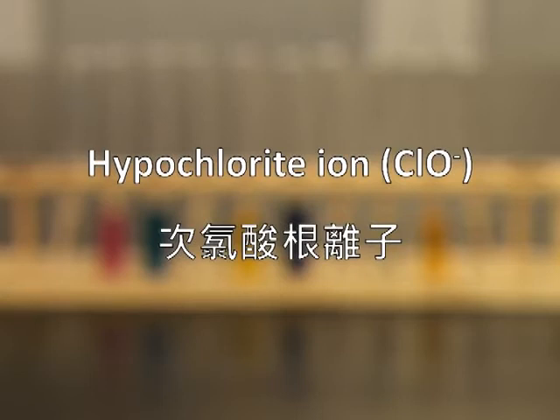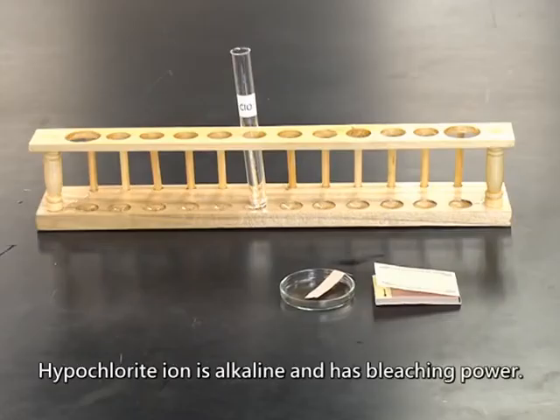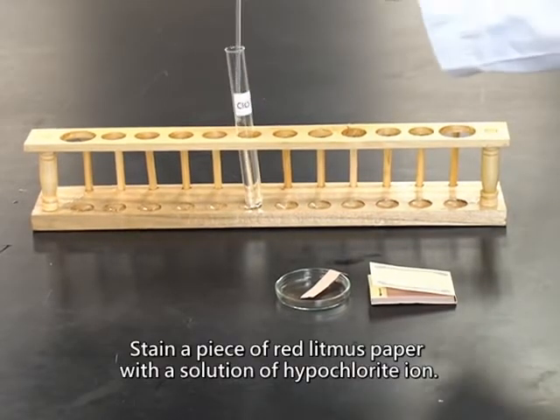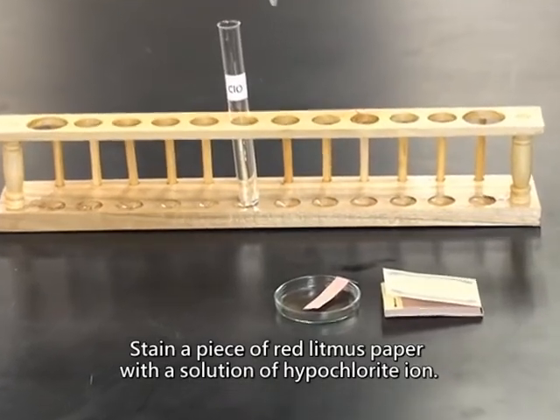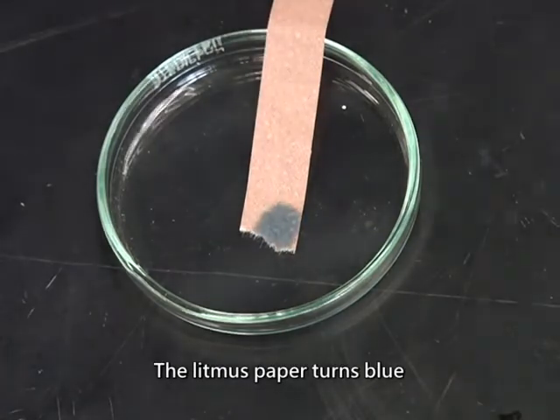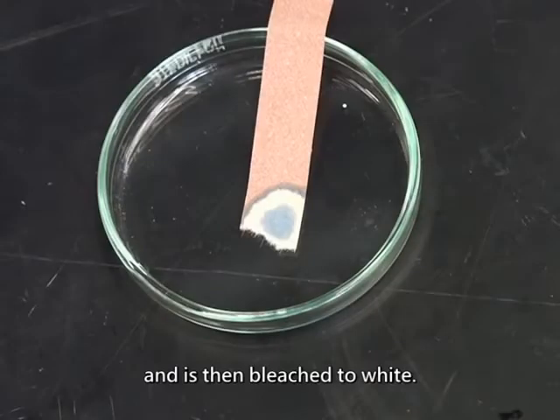Hypochlorite ion. Hypochlorite ion is alkaline and has bleaching power. Hence, it can be tested by red litmus paper. Stain a piece of red litmus paper with a solution of hypochlorite ion. The litmus paper turns blue and is then bleached to white.